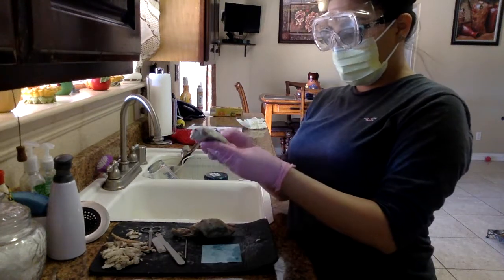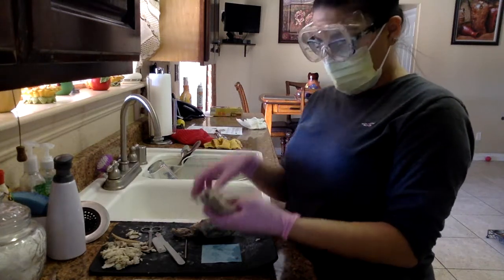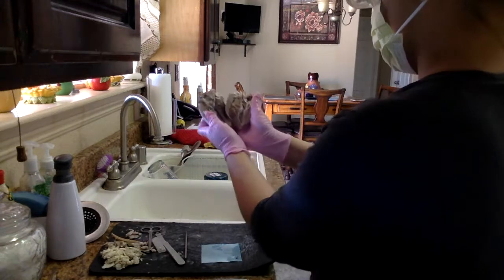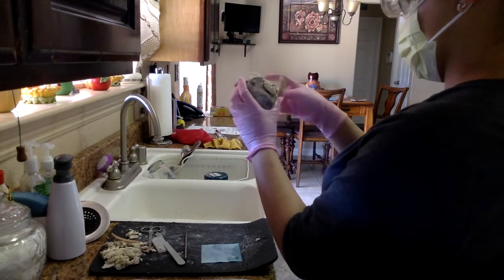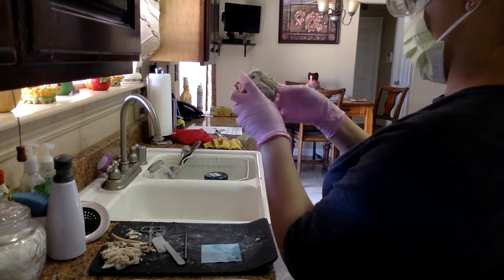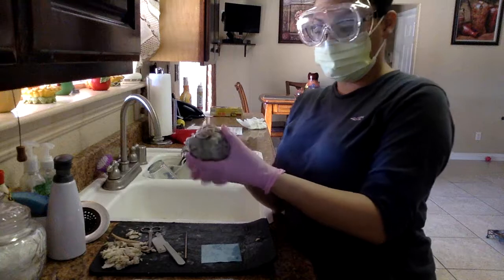If we look at the anterior portion of the heart, there's halves of everything because I cut everything in half, that way we can see both. This is the aorta here, but when we attach it, it'd be attached here, right? So then it would go through here.